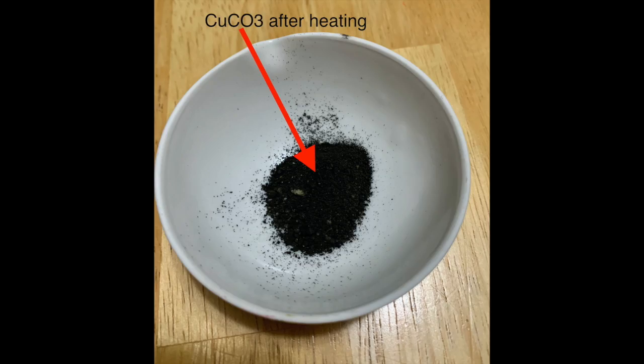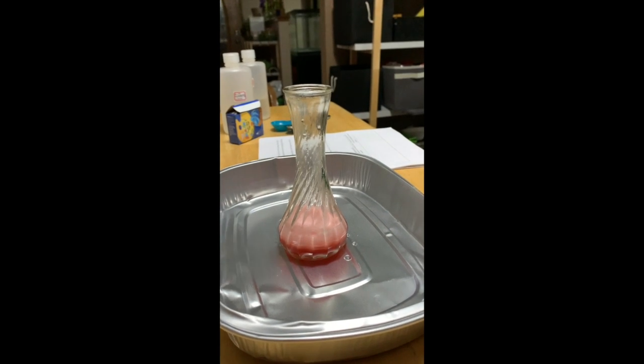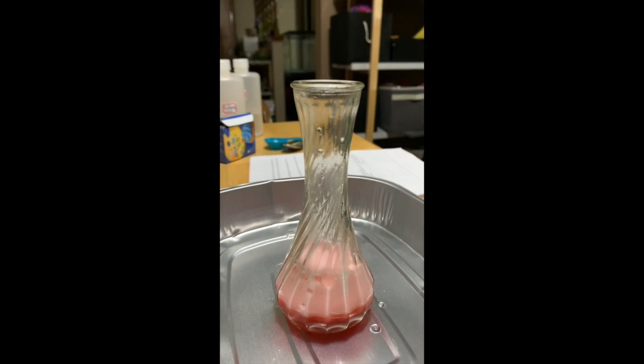So there it is after heating. Up next is another decomposition reaction.